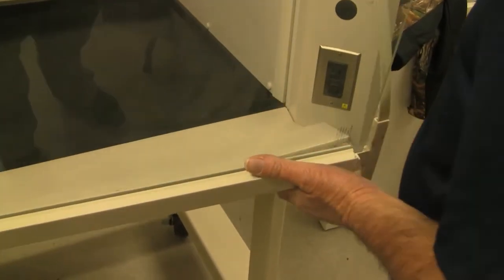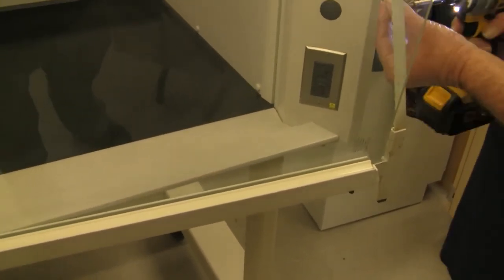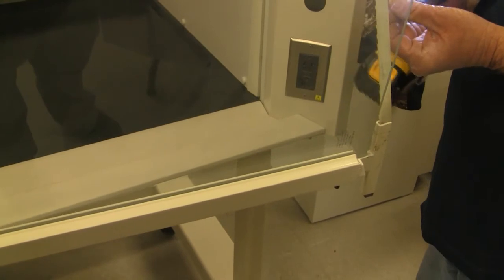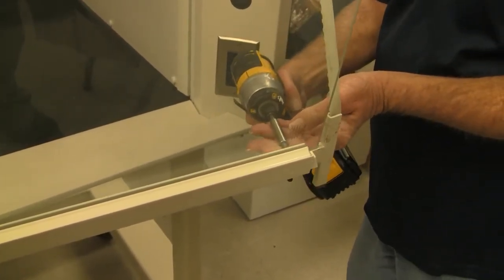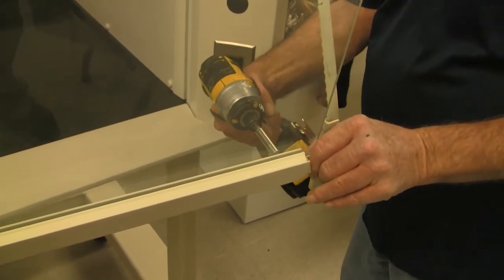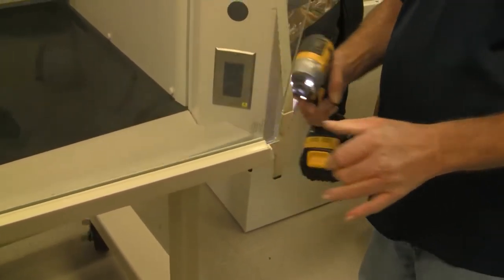Replace the belts and screws in the sash handle. Put the sash back into its tracks.